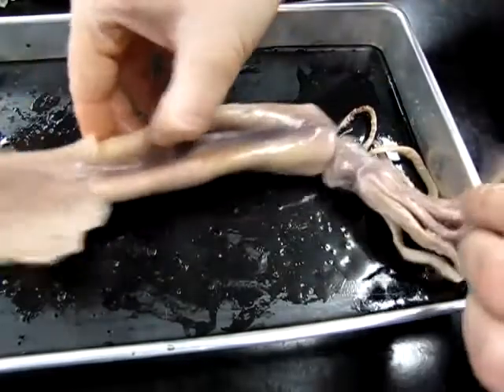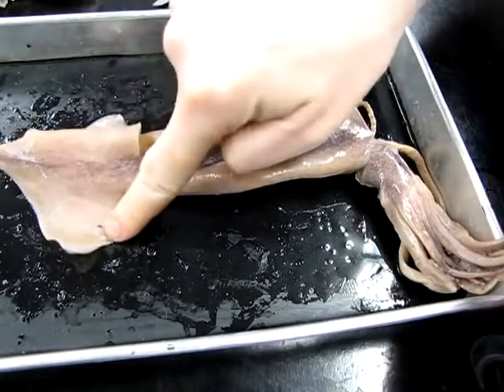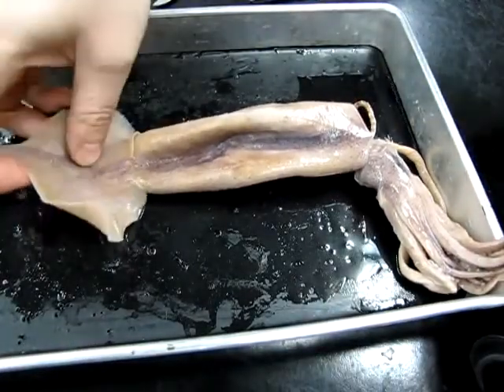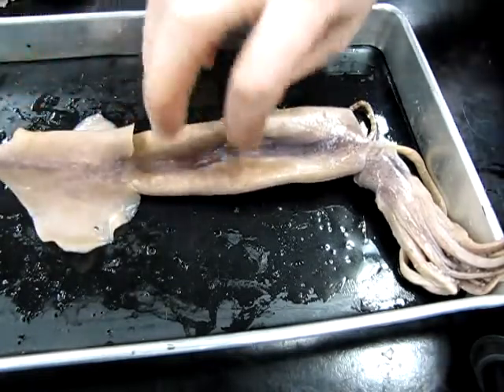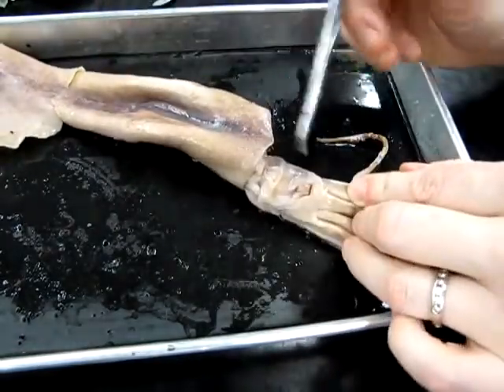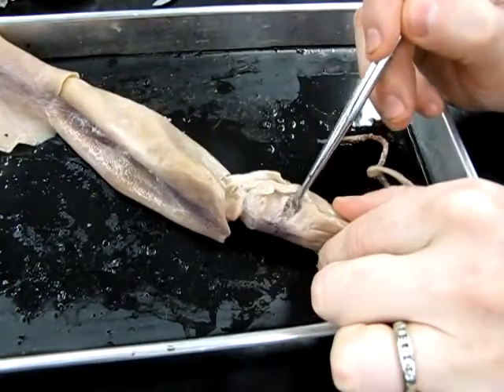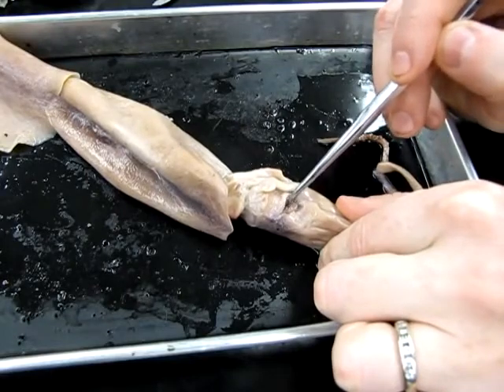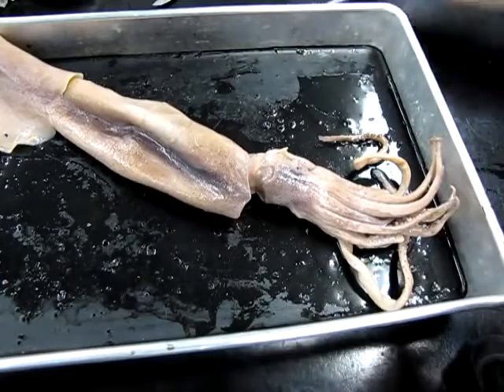The other things that we can see, obviously, at this end there are a pair of fins. So one fin, two fins here, and those are obviously used in locomotion. They use these to swim, to maintain balance, change direction, that sort of thing. At the other end, at the head, there are a pair of eyes. They're not very well preserved in this specimen, but this is where the eye would be here, and another eye here. You can see it's very large relative to the body, and there's a hard structure in there. It's a lens similar to ours, although not exactly the same.